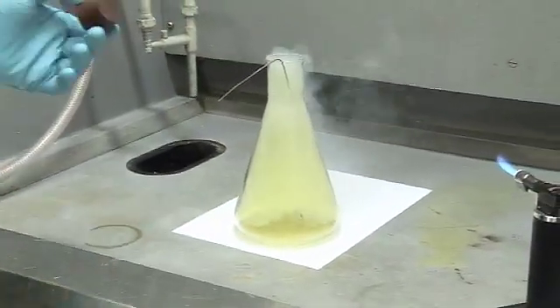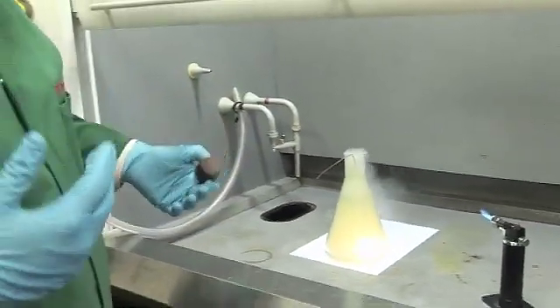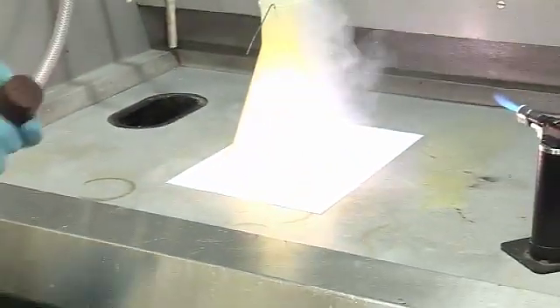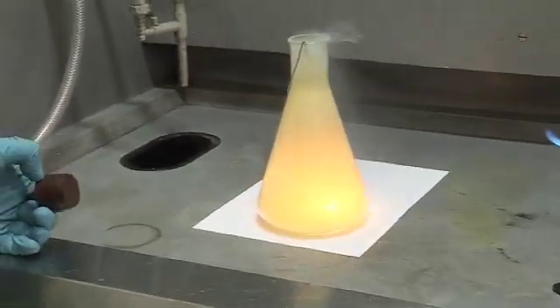Now instantly we're seeing aluminium trichloride coming out of the top and reacting with moisture in the air. So now you can see that the reaction is getting very intense and we're seeing a flame in the bottom. So the aluminium is being consumed as it's reacting, oxidising strongly in that chlorine rich air.